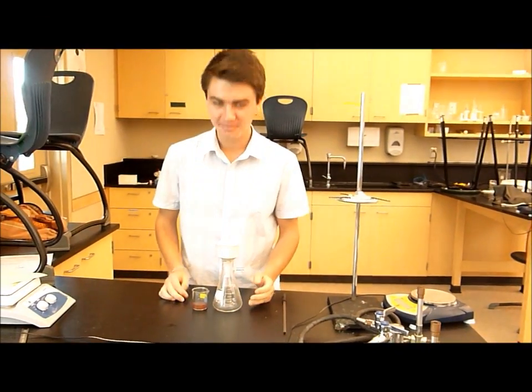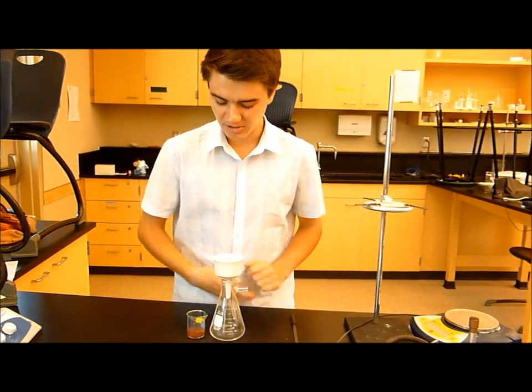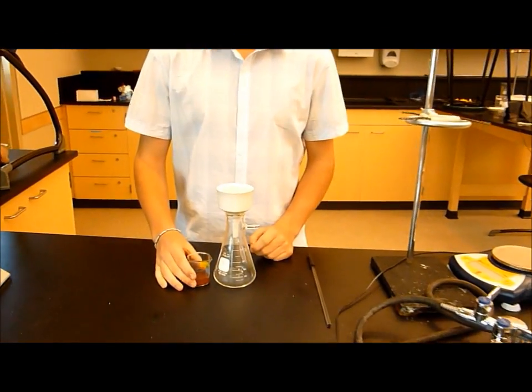Okay, this is where our lab deviates from the lab that you're given. So, we don't have the vacuum filtration equipment. So, what we're going to do is we're just going to filter it plain and simple.